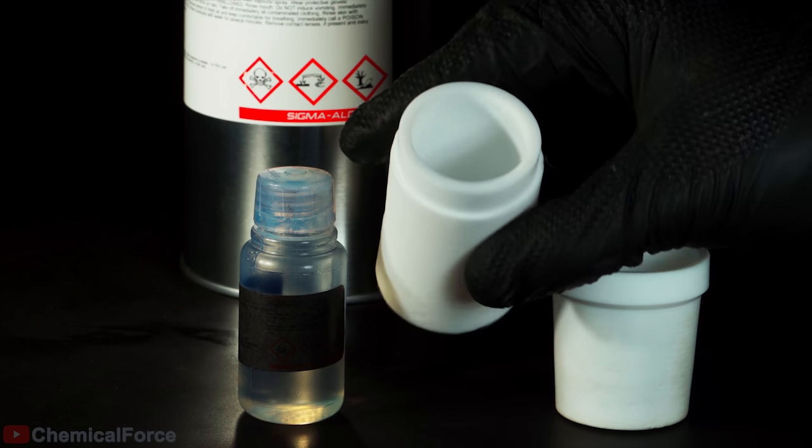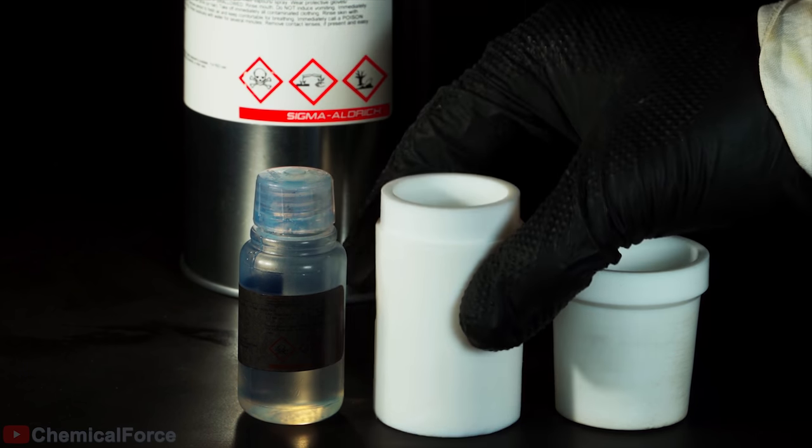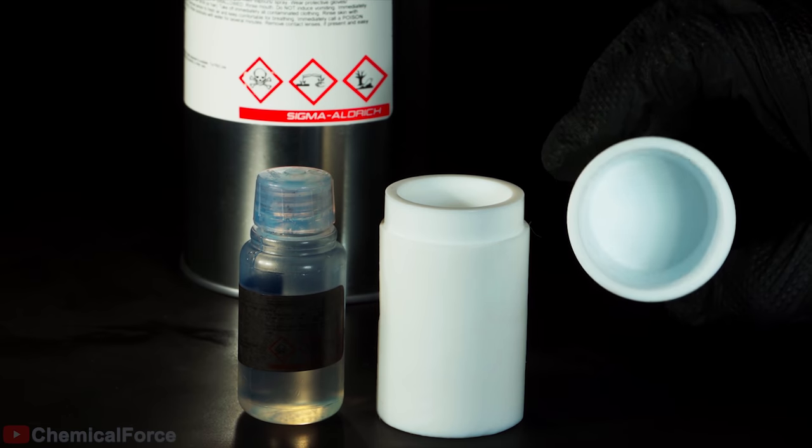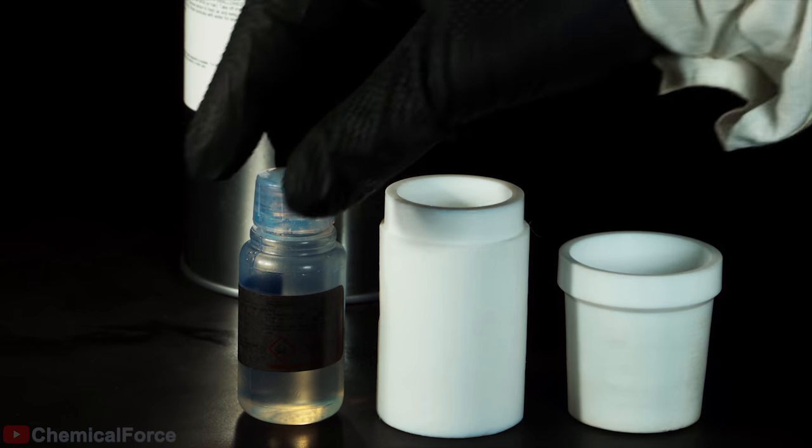Right after I open the container with the superacid, I'll place it in a special pre-arranged airtight Teflon container for further storing.